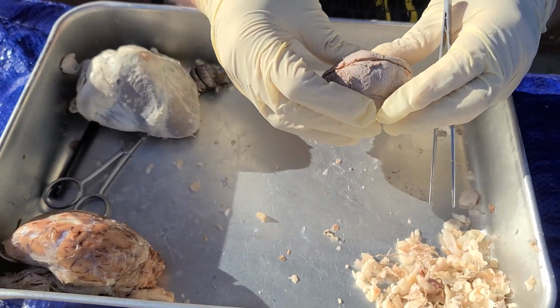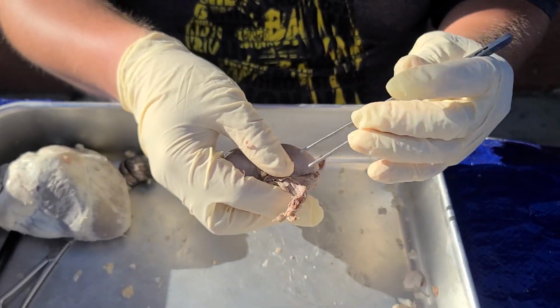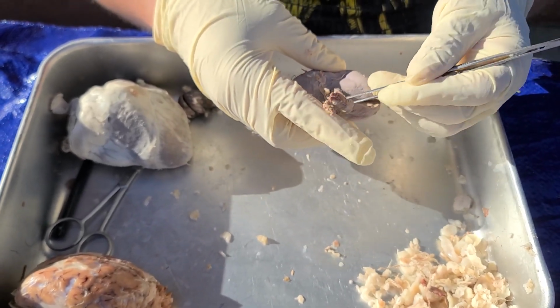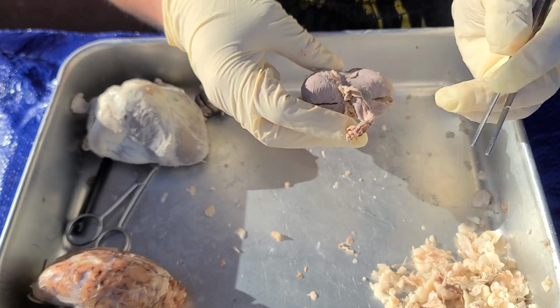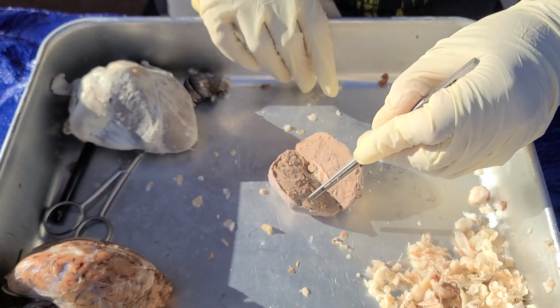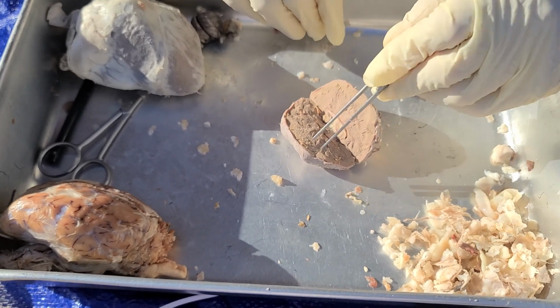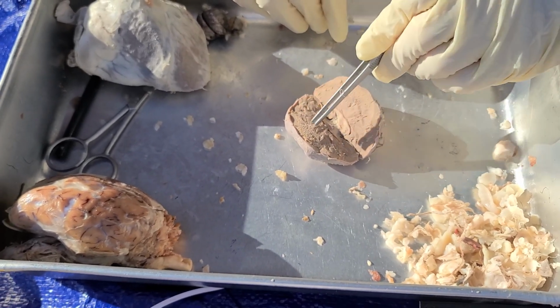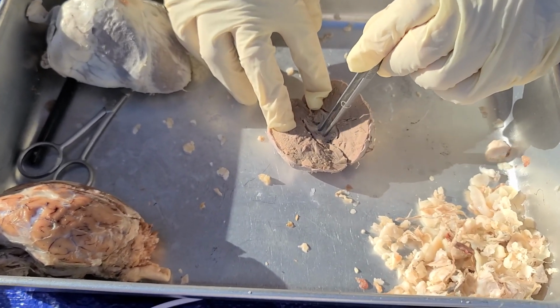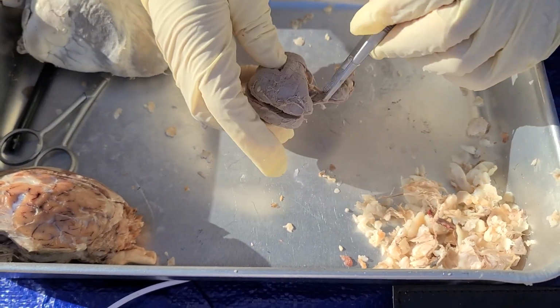Now we have the kidney. On the outside of the kidney we can see this extension, which is the ureter, also part of the veins that extend outside of the kidney. We look inside. This clearer, outer part of the kidney is called the cortex. The darker parts, more inside, are the medulla, the pelvis, and the hilum, which is the combination of part of the pelvis and the outside.